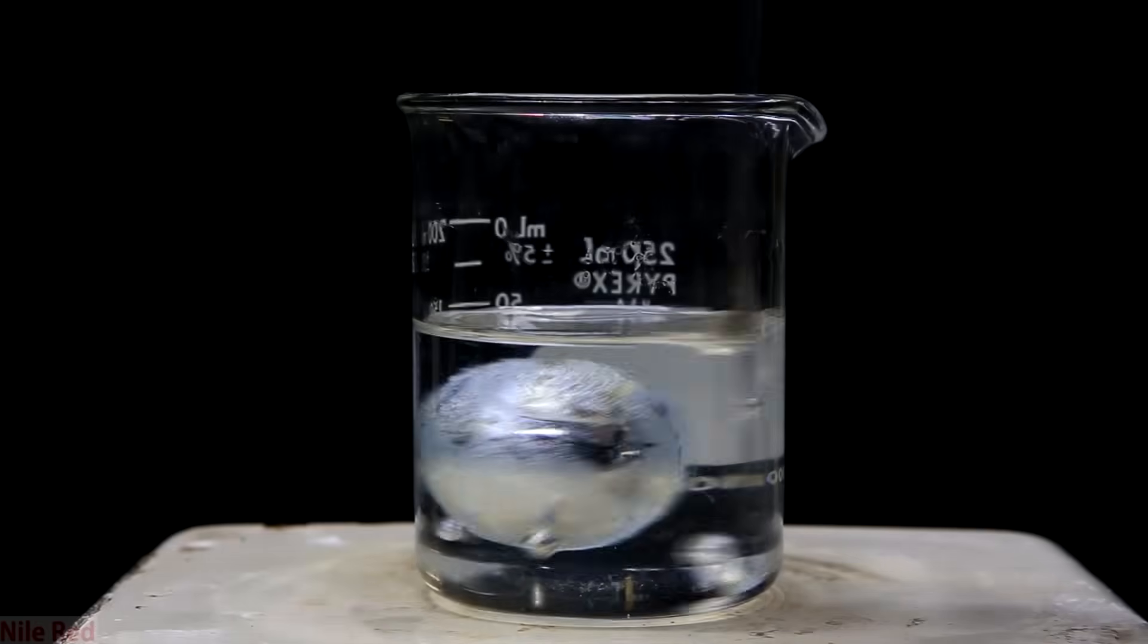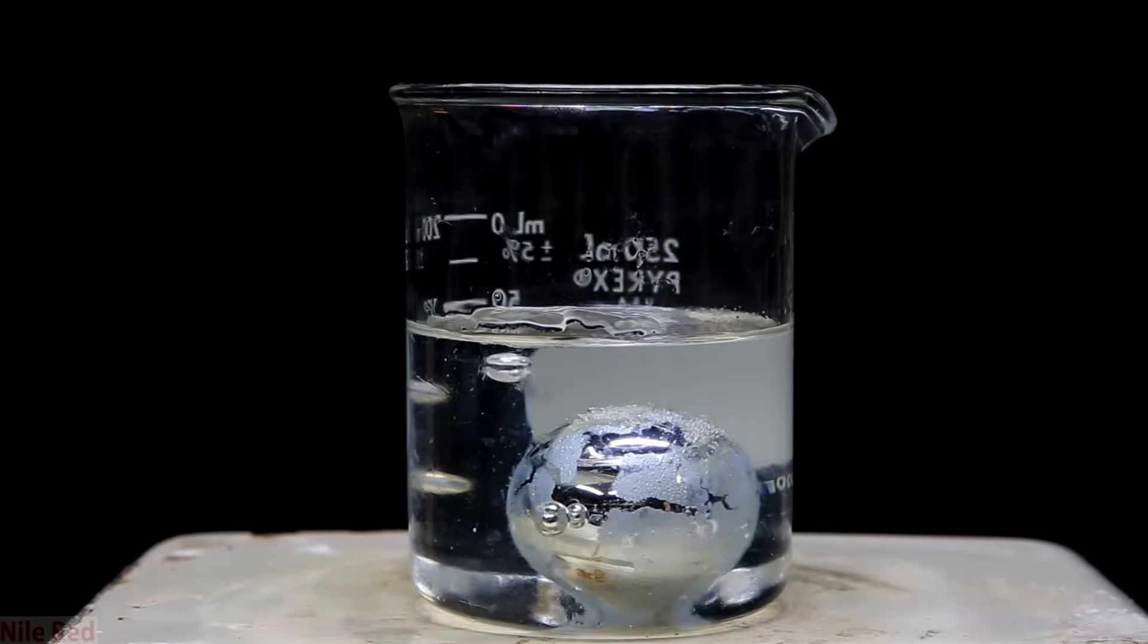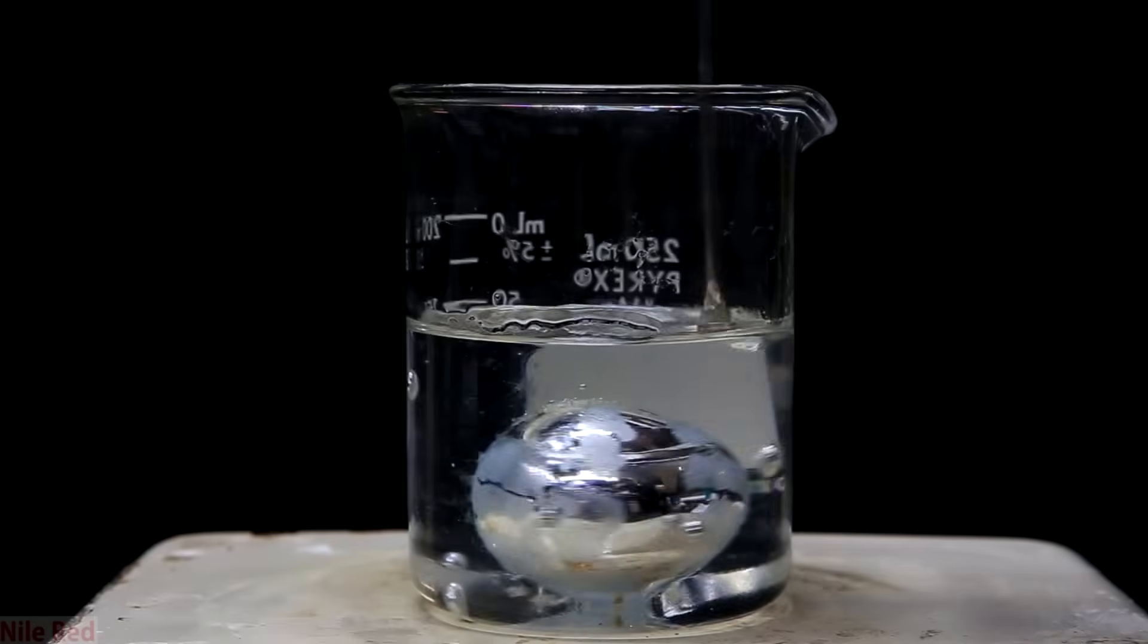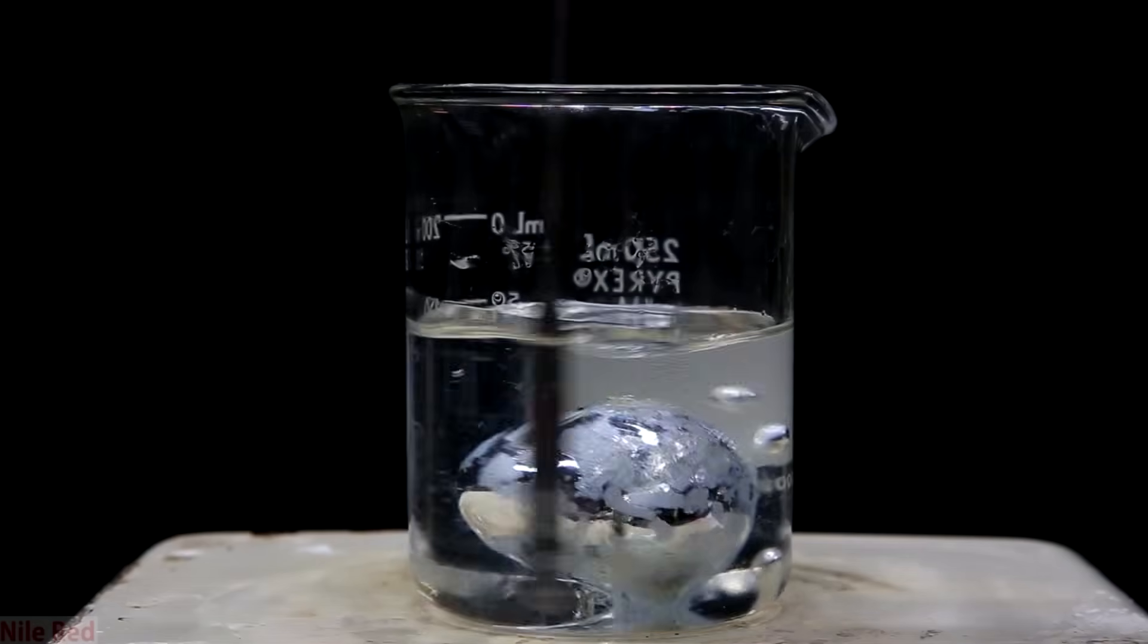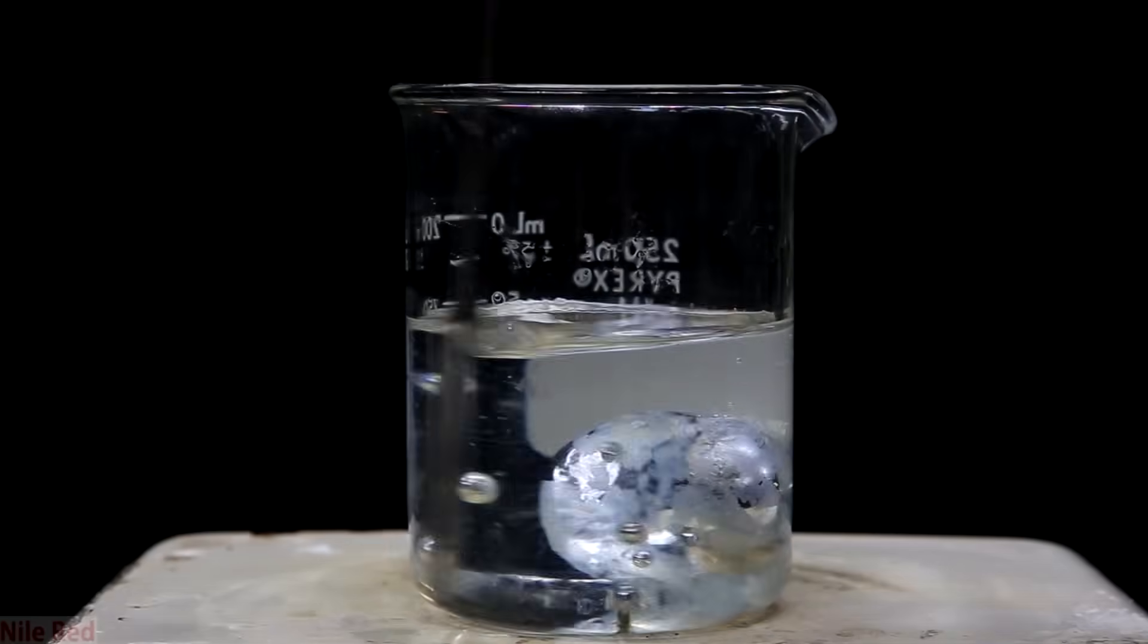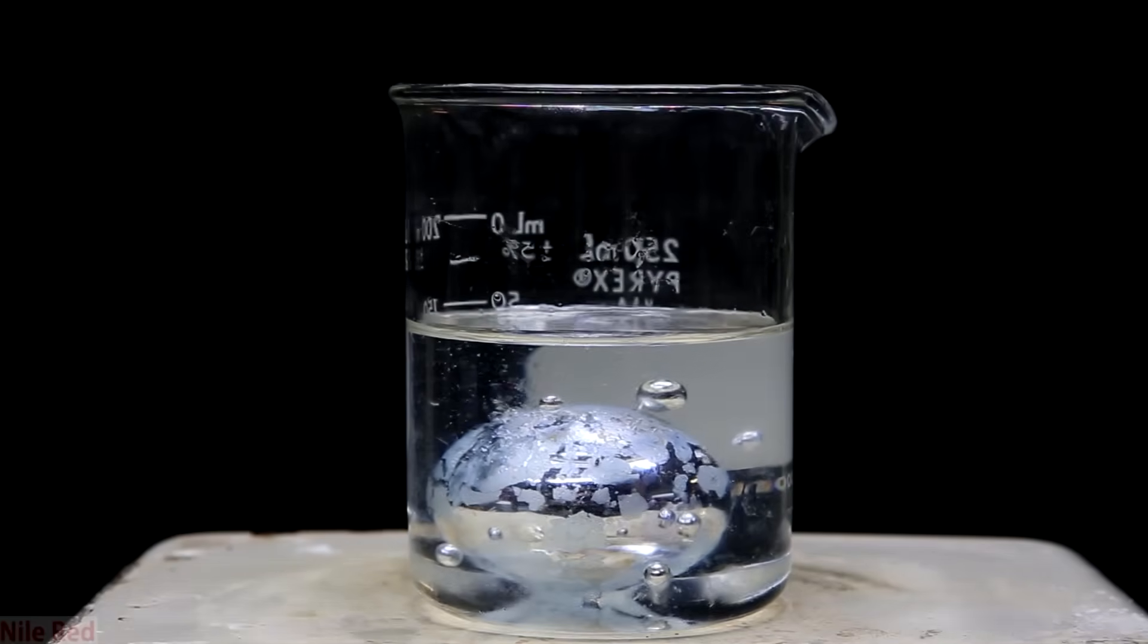Also a small amount is bound to form anyway, so there's no real sense in trying to get rid of all of them. So once it's melted you can see that there are solid oxides on the outside. My hopes in remelting it was that I would get all the small pieces to coalesce together, but unfortunately that was pretty hard to do and it didn't happen.